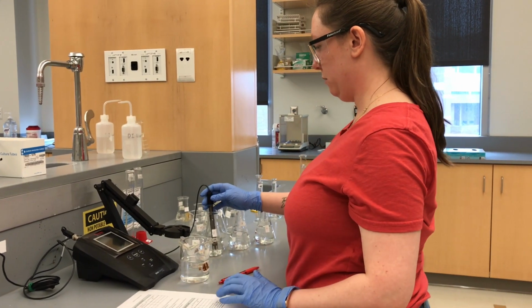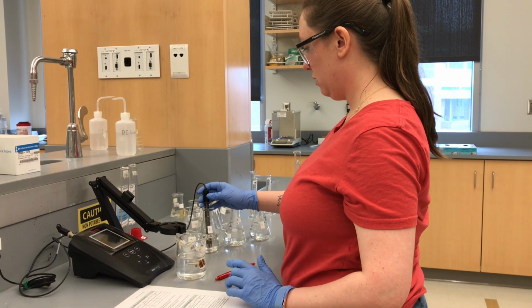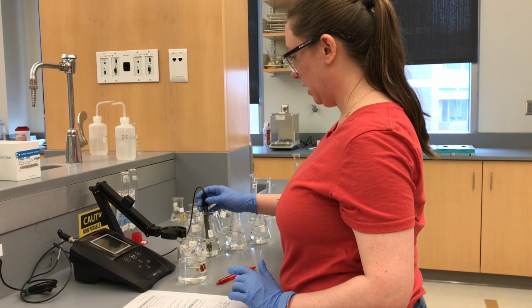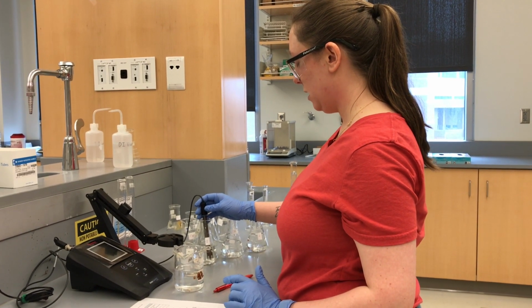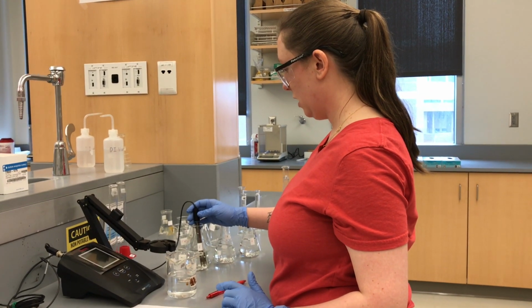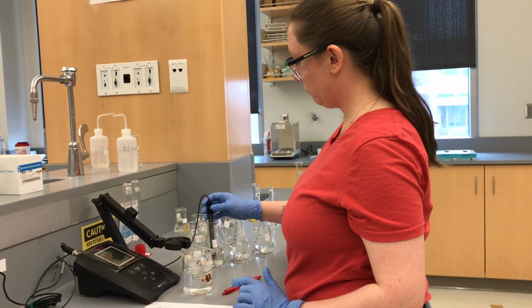Okay, so according to our pH meter, our pH is, come on, Tara, what are we waiting for?